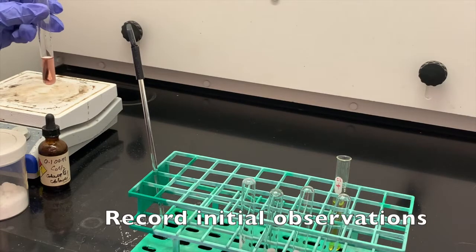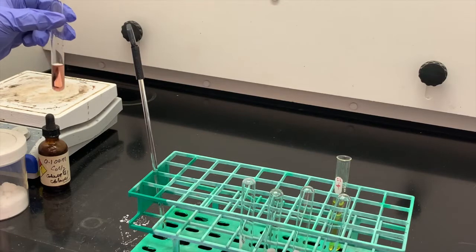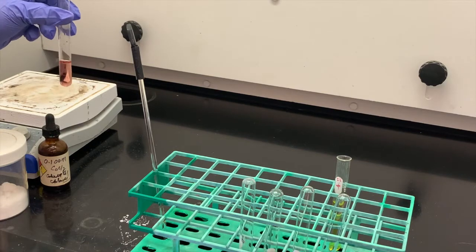So again, make sure that you make your observations on what you see in this test tube before we add anything to it. And what we're adding to this test tube is going to be concentrated hydrochloric acid.